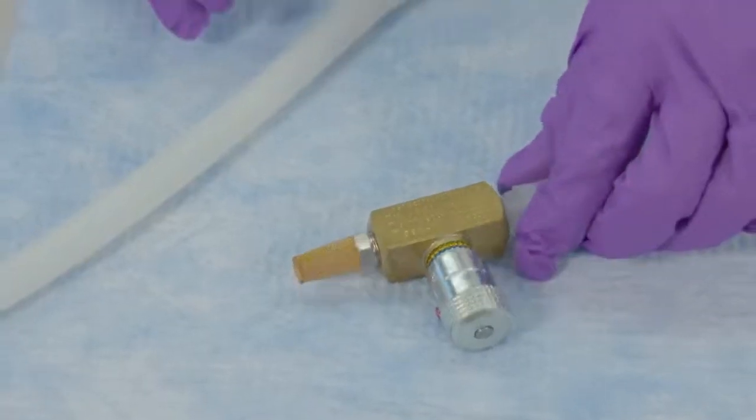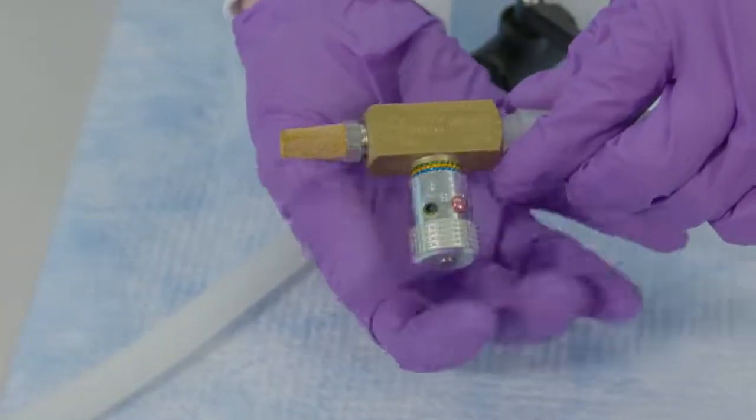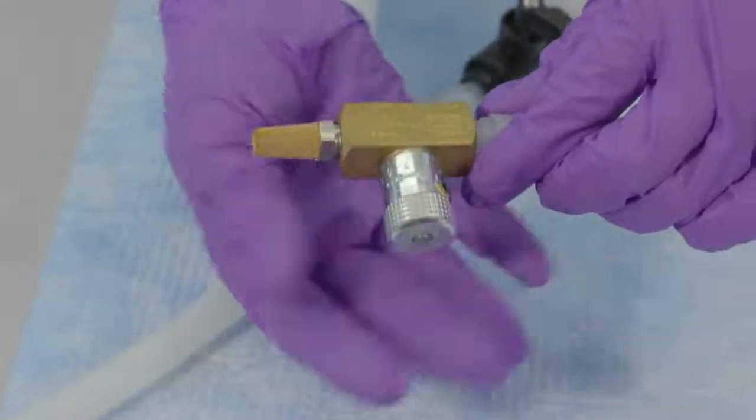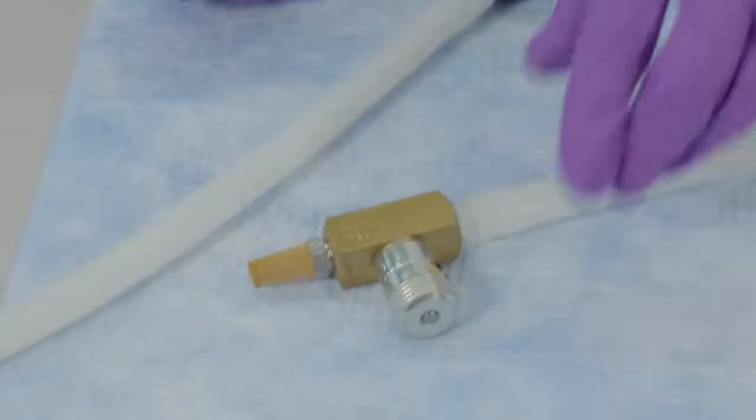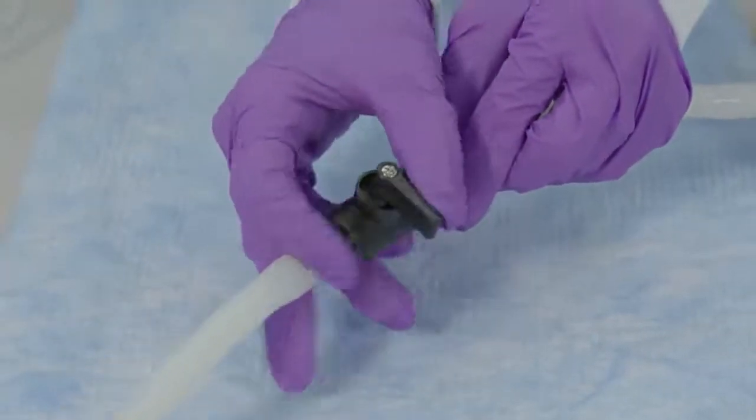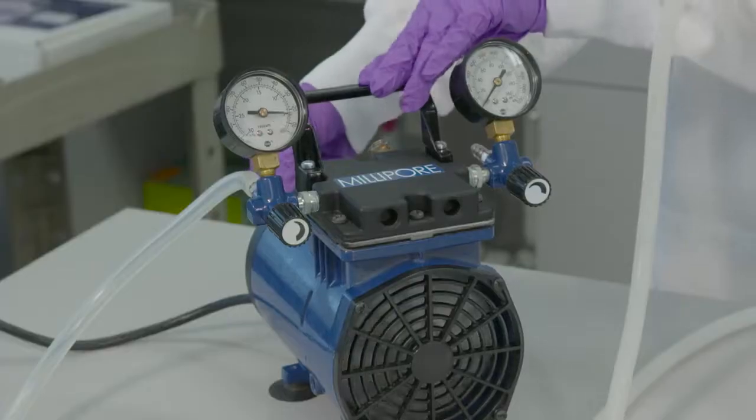Turn the vacuum control down to cover the color bands. This will close the valve to get maximum vacuum. Turn the on off valve closed. Now turn on the vacuum source to maximum.